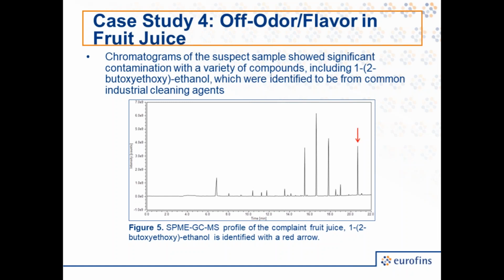I've marked one of them with an arrow on this chromatogram, or in this profile. And this was identified as 1,2-butoxyethoxy ethanol. And as with the chocolate animal crackers, its exact structure isn't super important. But what is important to know is that it is found in some common industrial cleaning agents. So as with the chocolate animal crackers, this indicated that the products were being contaminated with cleaning agents. And so by improving the rinsing procedure, this issue could be avoided.